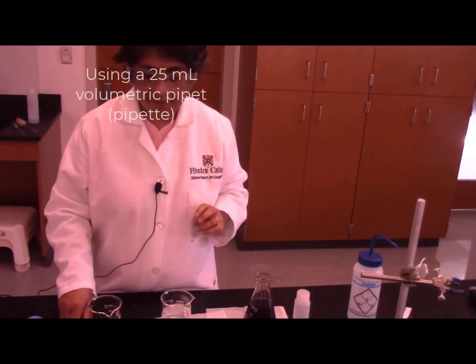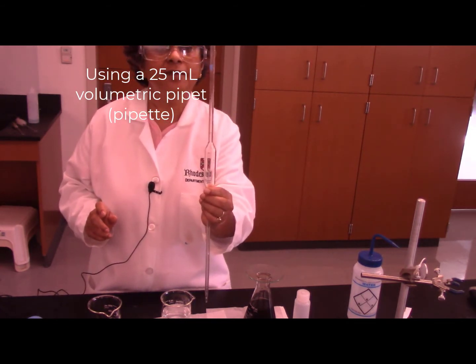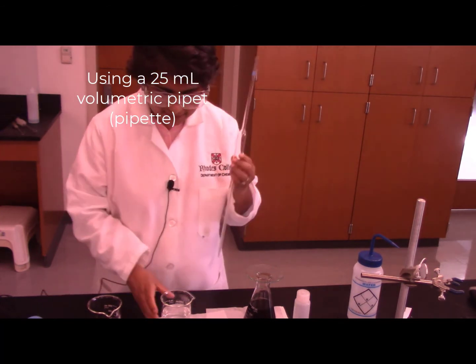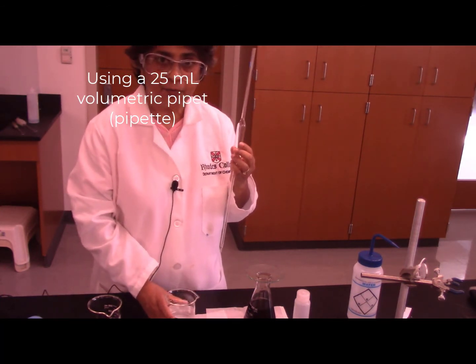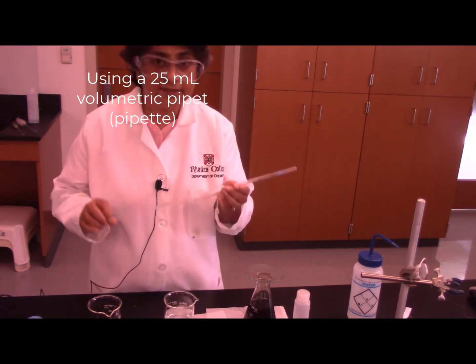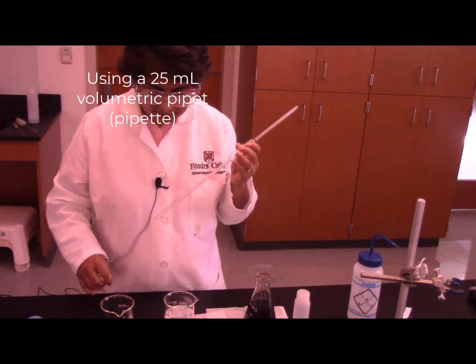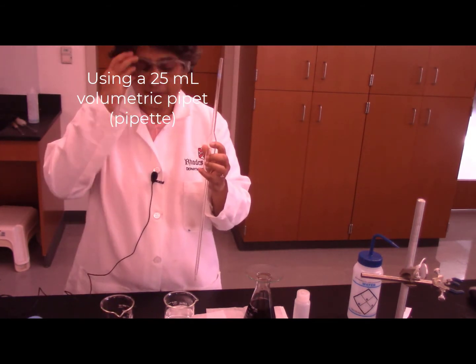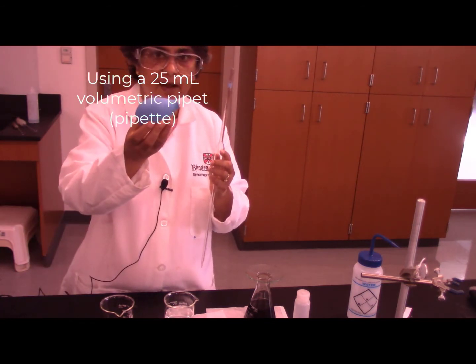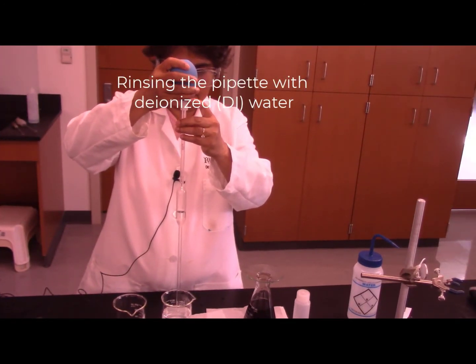Hi class, now I am going to show you how to use the pipette. This is a 25 milliliter volumetric pipette. Here I have some deionized water with which I will rinse the pipette. I also have a waste beaker here. Let me show you how to clean the pipette first. This is the pipette bulb. I am drawing DI water into the pipette.